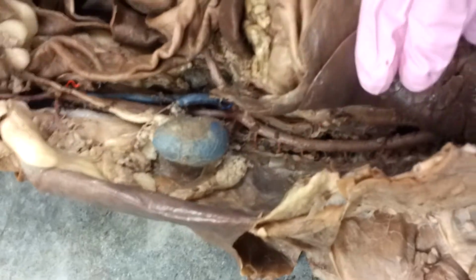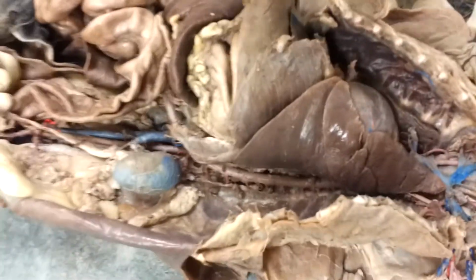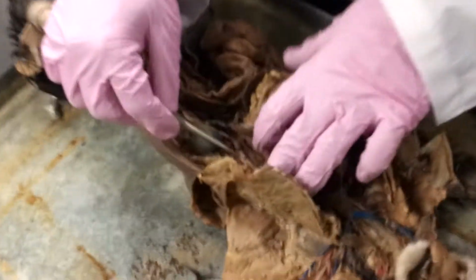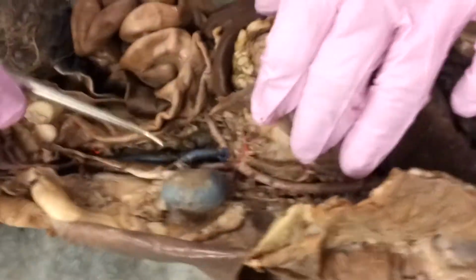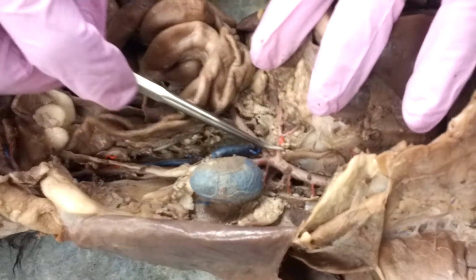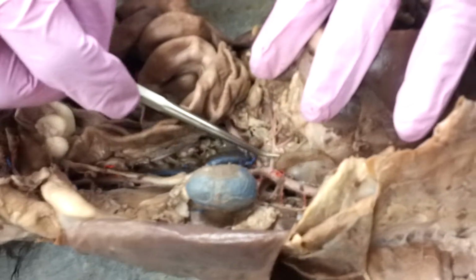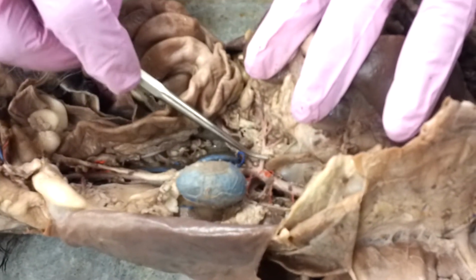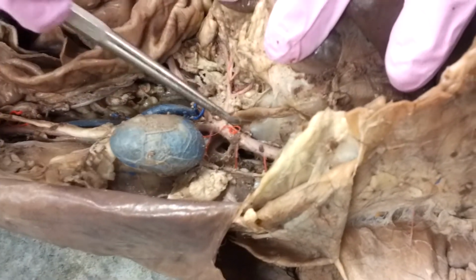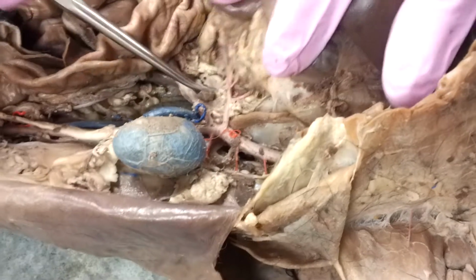As we go down, we've just finished the arteries of the head and neck. Now we're going to the arteries in the mid-body, then we'll go to the arteries in the lower body. So we've cut through the diaphragm. When we cut through the diaphragm, the first thing we're going to do is find one branch. And this first branch is what's called the celiac trunk. First branch, once we've cut through the diaphragm, is going to be that celiac trunk.